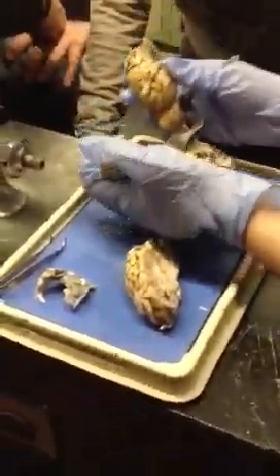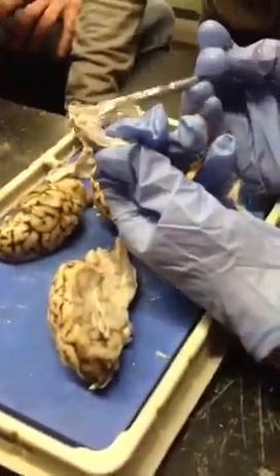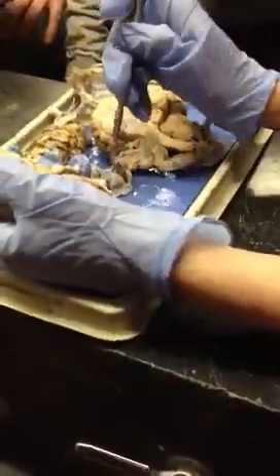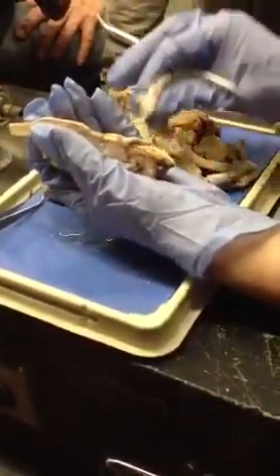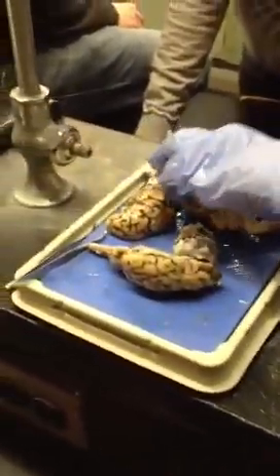Then the only other thing that may or may not come up is that they might stick a pin in this piece of the dura, which was removed from here. And in that case, can anybody guess what that would be? So it would be right here. The pituitary. It's broken off of all your brain models, and it's broken off of your sheep brain. But I have seen them do that before. So keep an eye out for that.